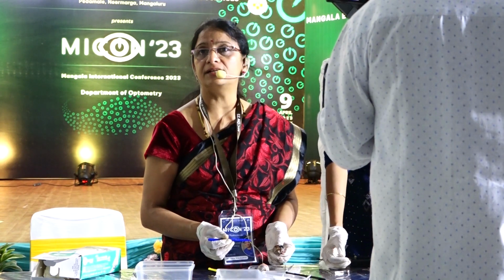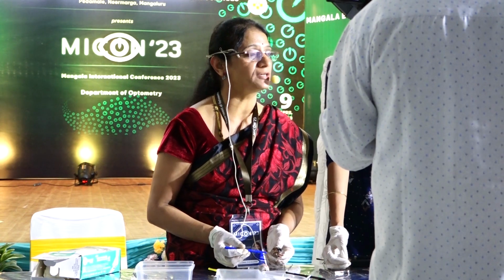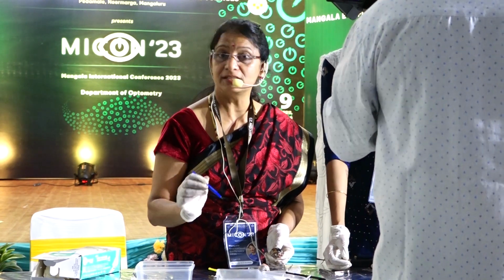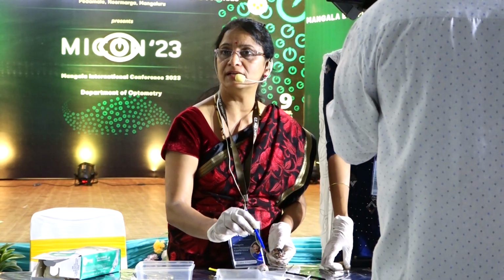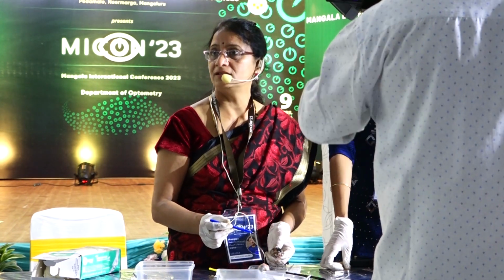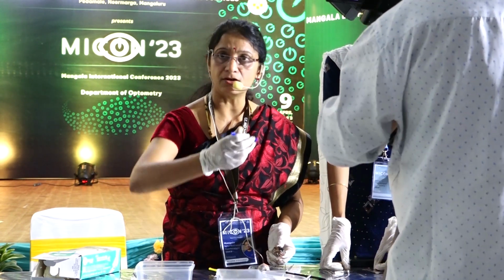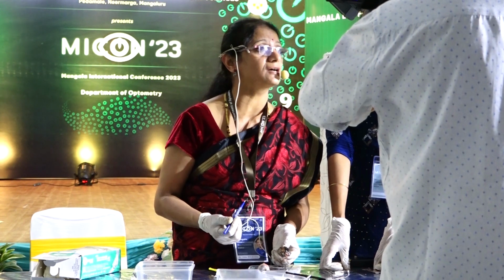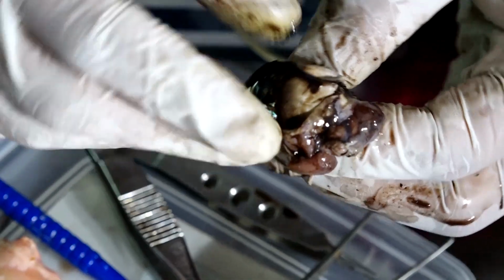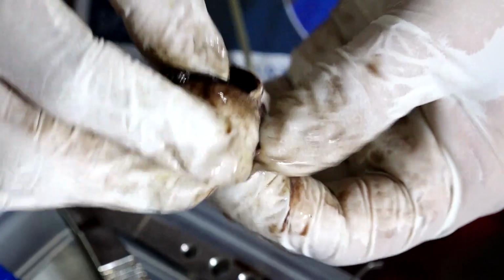So did you see 3 different pigmented structures in the eye? Which are the 3 pigmented structures you saw in the eye? One is choroid, one is the ciliary body, the pigmented area around the lens, and we first removed the iris. The 3 pigmented structures are iris, ciliary body and the choroid. They are all continuous with each other, and together they are called the uvea. Very good.